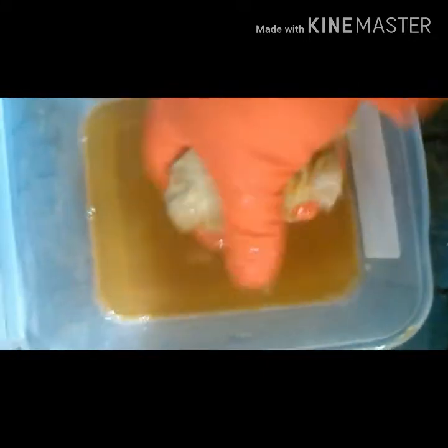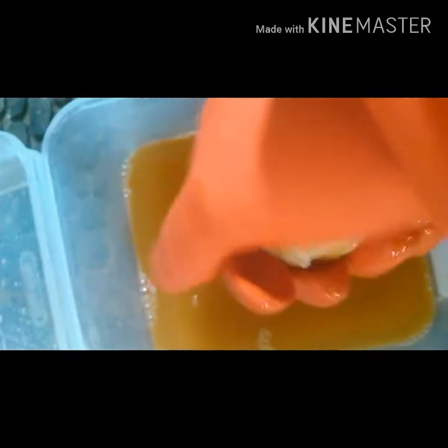So I changed my mind. What I did was I grabbed the filters out and threw them in here, and then I put just straight water in here. Now I'm just mushing these into the water, trying to get any of the liquids they still have in there out. From distilled water turning to that color is pretty good. At the end, I'm going to put this water into the main container.